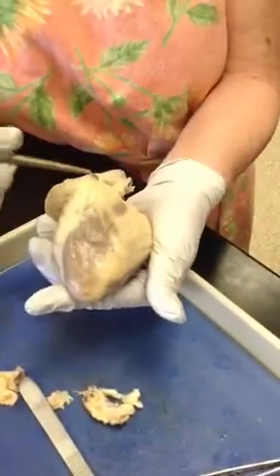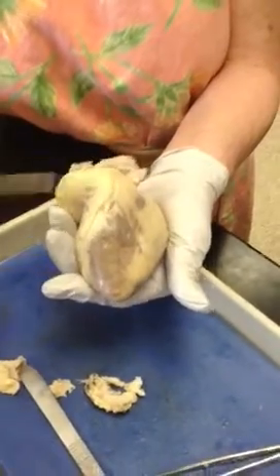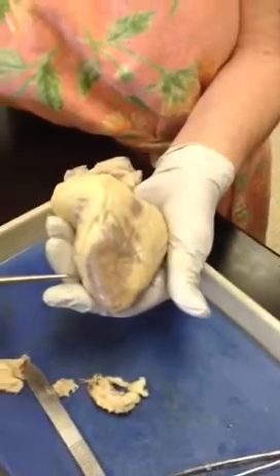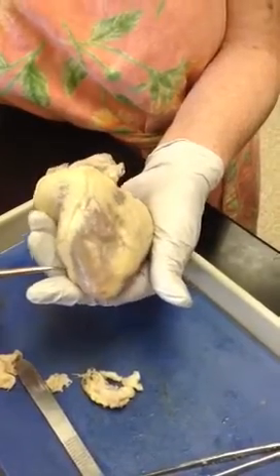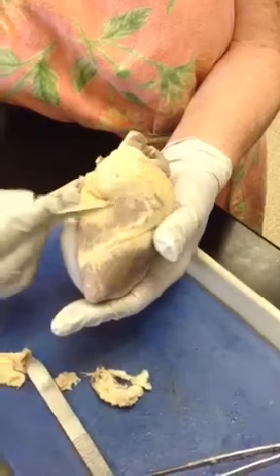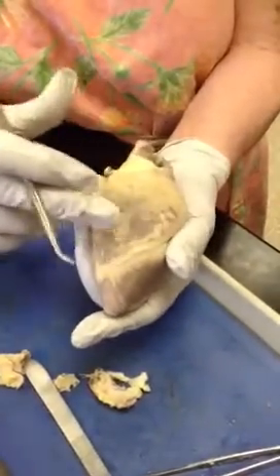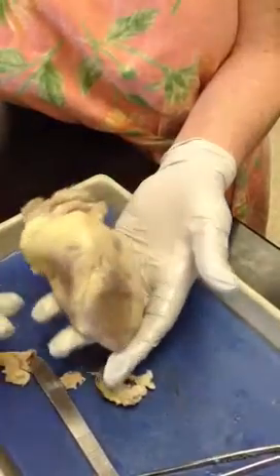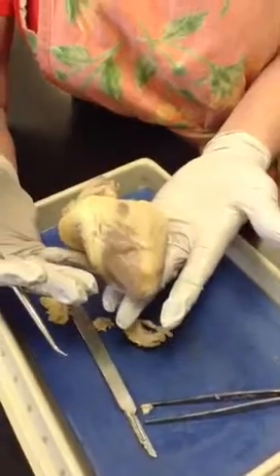Here is the anterior interventricular sulcus. That's going to contain the coronary arteries and the coronary veins. And it looks like actually you're going to have a little piece of blood clot in the right side, especially when you can see a depression like that. Those are the vessels.